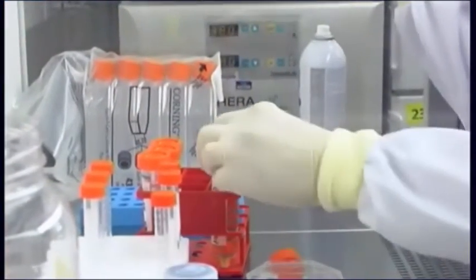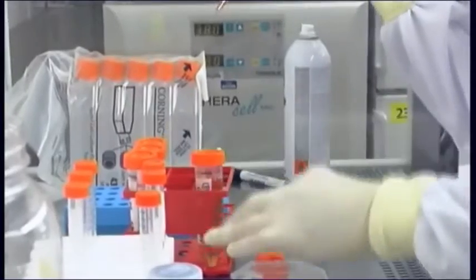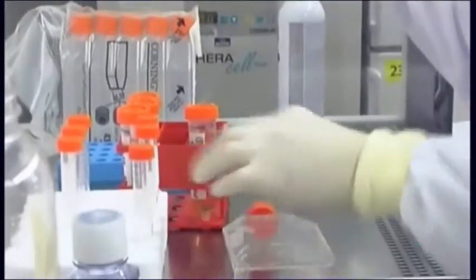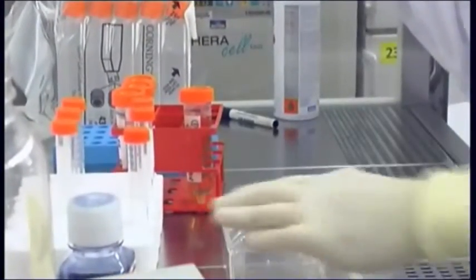Inactivate the trypsin by addition of serum in the form of fresh growth medium or the spent medium removed earlier in the process.